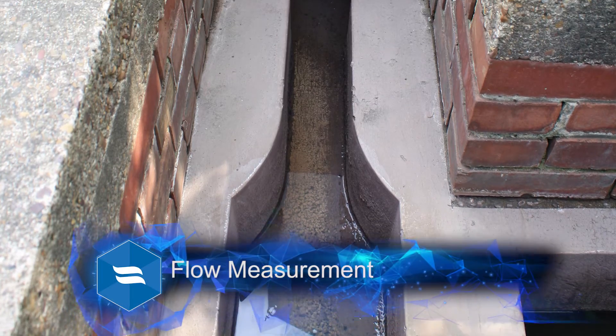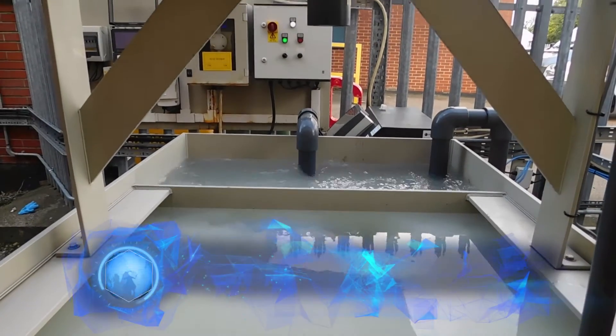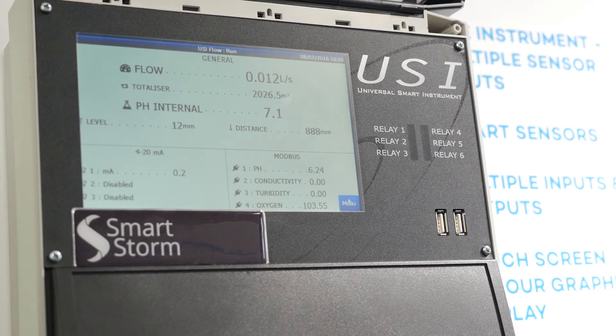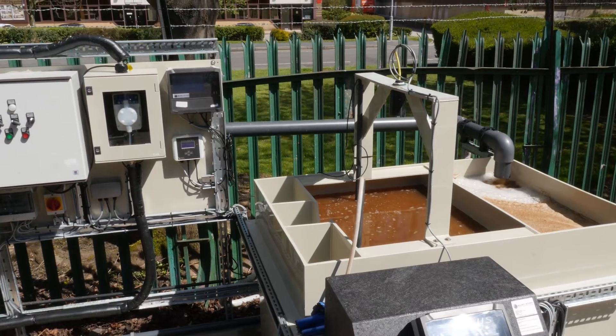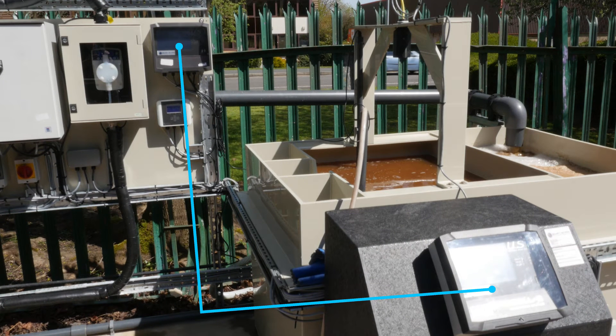How do we monitor these parameters? Flow measurement is measured using open channel primary devices known as weirs and flumes, positioned at the outlet from a factory to the main sewer. The level of effluent is measured in a device by an ultrasonic sensor which converts this to a flow reading. Flow can also be measured using a closed pipe flow meter known as mag flow or induction flow meters. The flow meter is connected to an automated wastewater sampler which, on a controlled pulse from the flow meter, builds up a composite representative sample of the wastewater in a bottle, filling it over 24 hours.